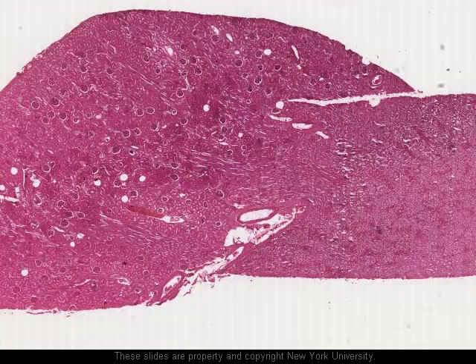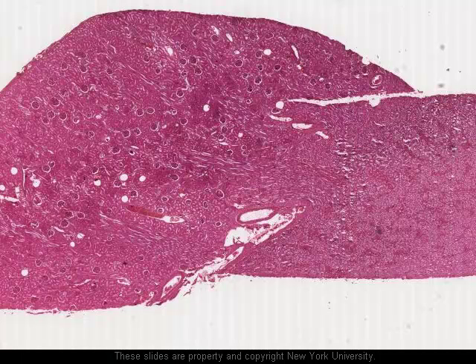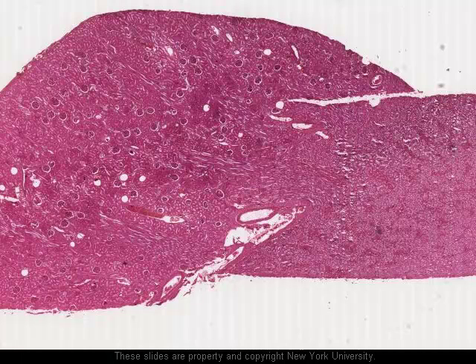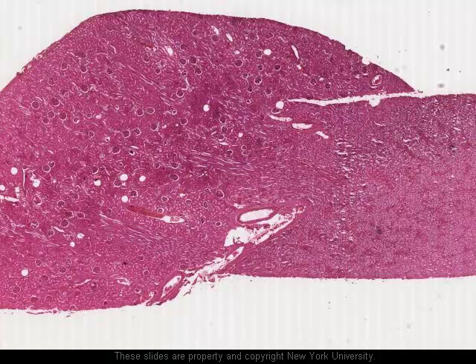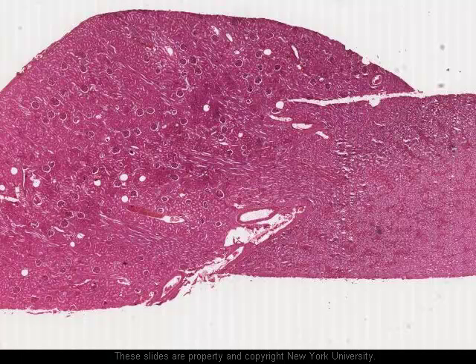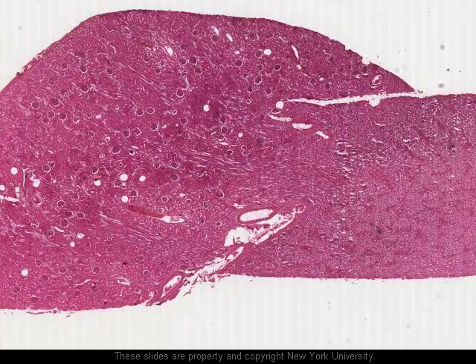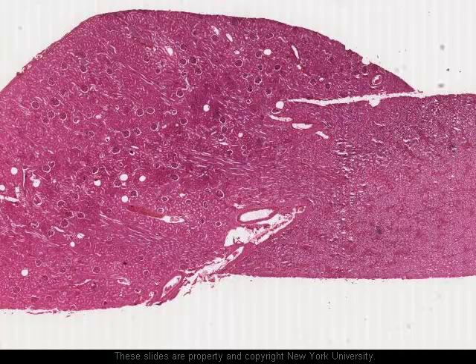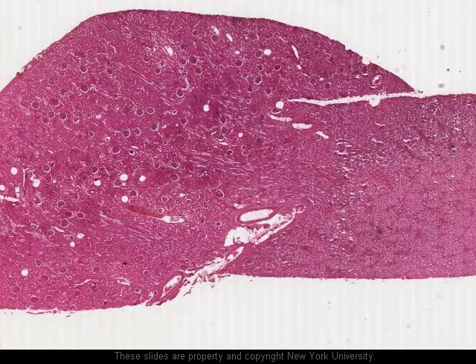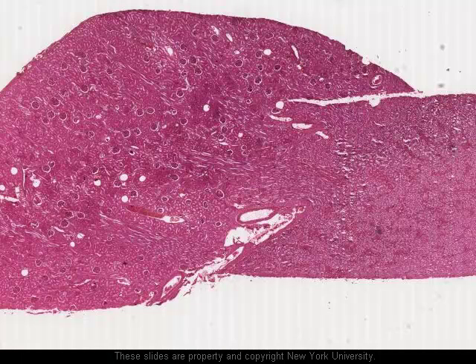Once again we're at lower magnification. Here again is the cortex, here are the glomeruli in the cortex, and along here is the boundary between the cortex and the medulla. Remember from the notes that the most important nephrons in setting up the interstitial sodium gradient are those found at the boundary between the cortex and the medulla — the juxtamedullary nephrons. We can see here the tubes extending in toward the medulla, and these form the medullary rays which are present in the cortex.